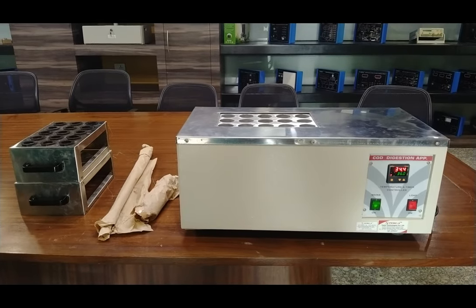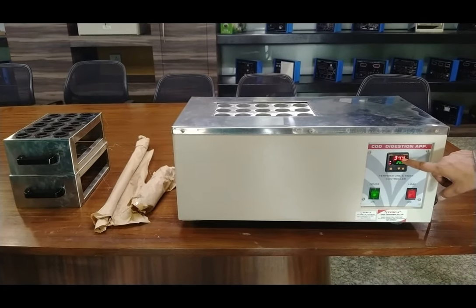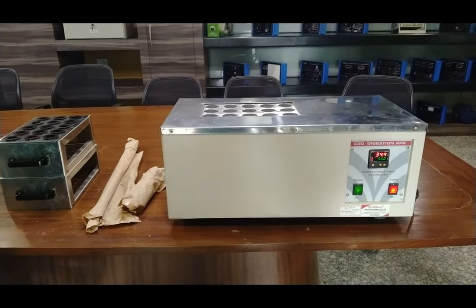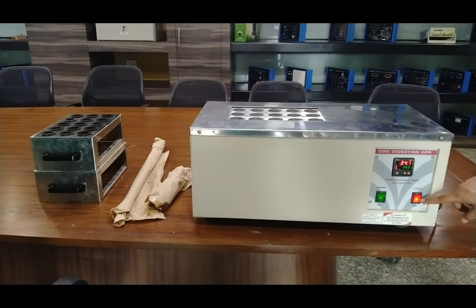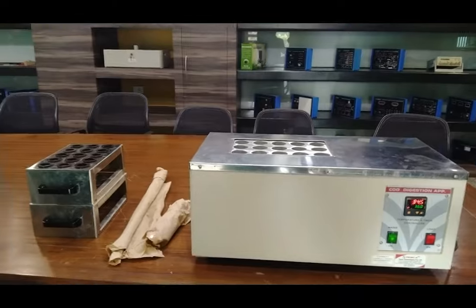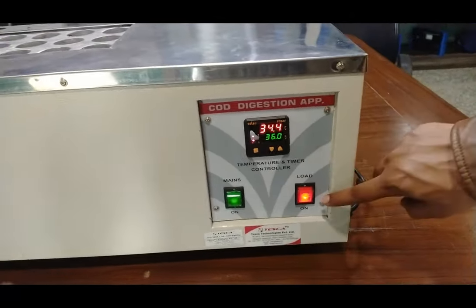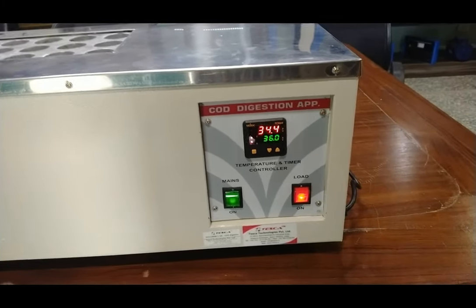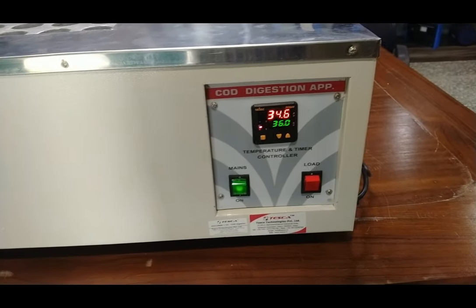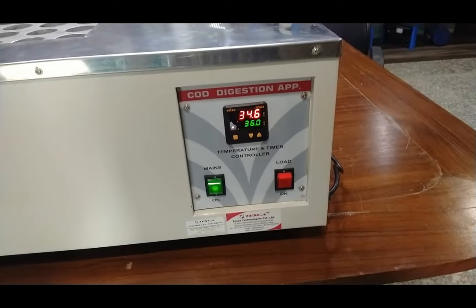You can see when it reaches 36 degrees Celsius. Turn on this load switch — it will start blinking after some seconds. This load switch blinking indicates the temperature is increasing. When it reaches 36 degrees Celsius, the PID controller will maintain the temperature at 36 degrees Celsius.